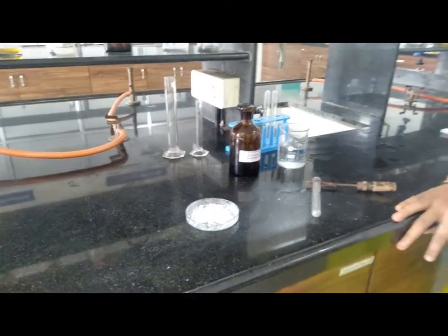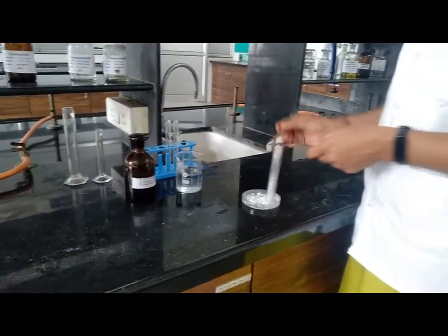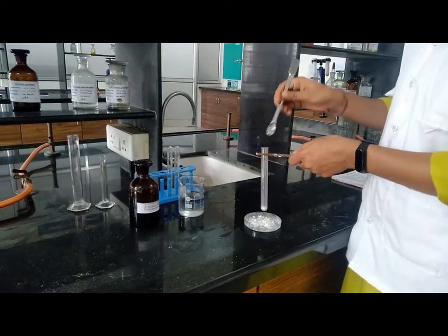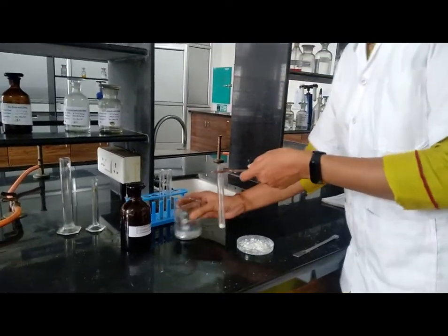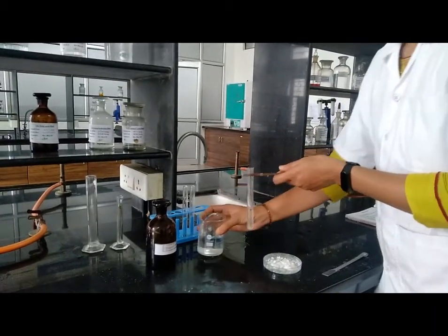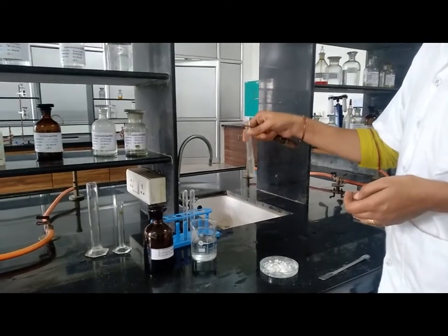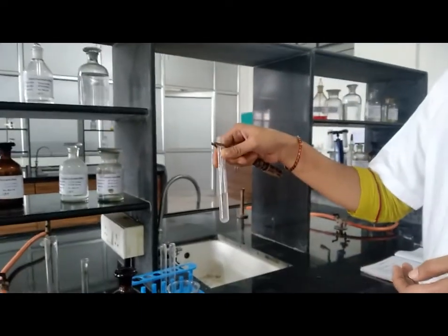Now let's start with solubility. Check the solubility in water. For that, we have to take sample, approximately 0.2 to 0.3 grams, then add water. Shake it vigorously and check the solubility. The given sample is freely soluble in water.